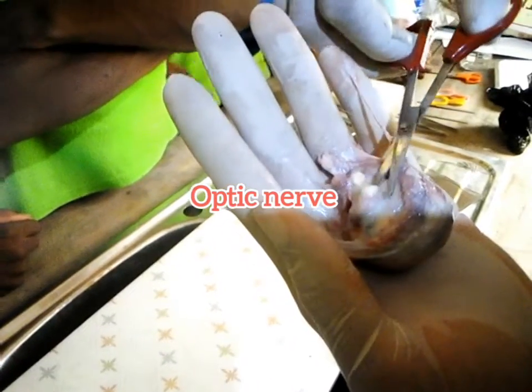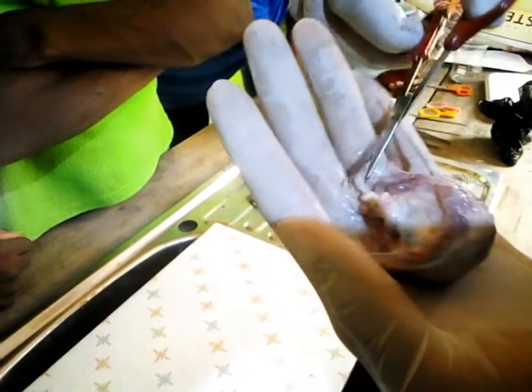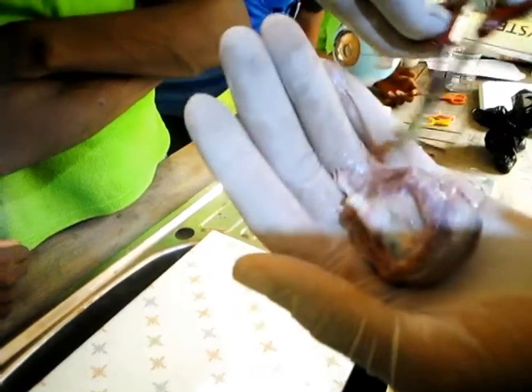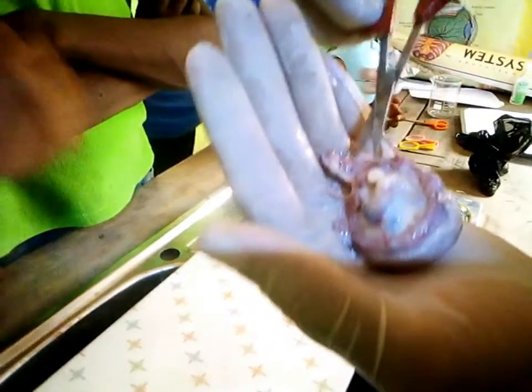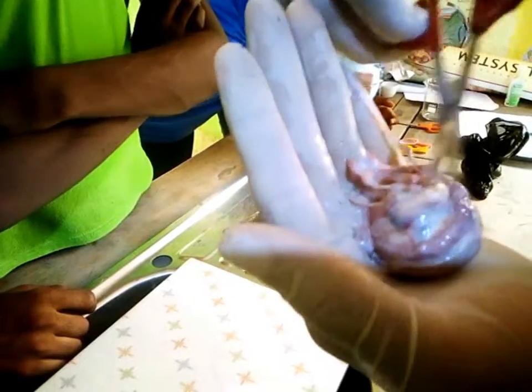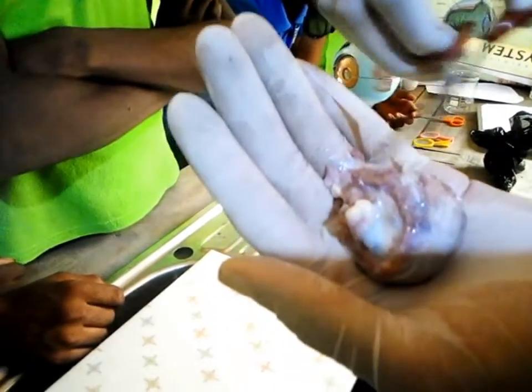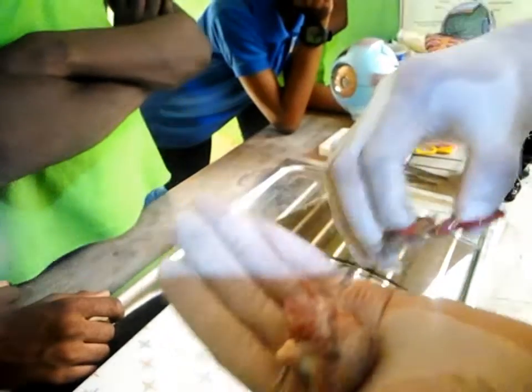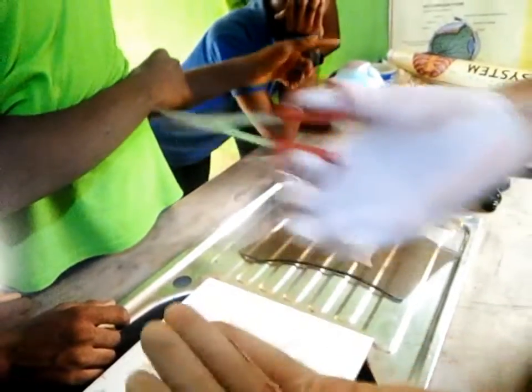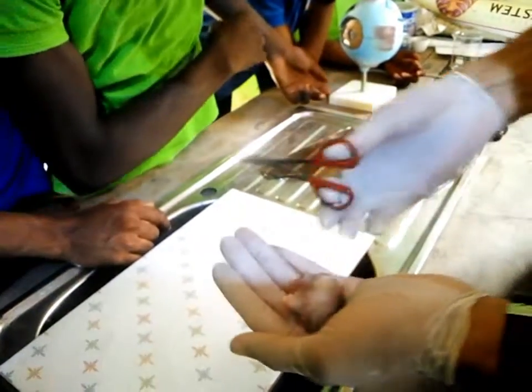I believe this should be the what? The optic nerve. You can see it. It should be part of the optic nerve. Now around there are the muscles. You can see them. Can you see it? These are the muscles. Are you getting me? Like I told you, this muscle you are seeing here helps in what? In moving the what? The eye in the eye socket. Are you getting me? That helps in moving the eye.